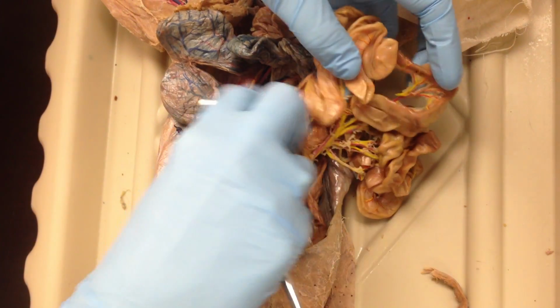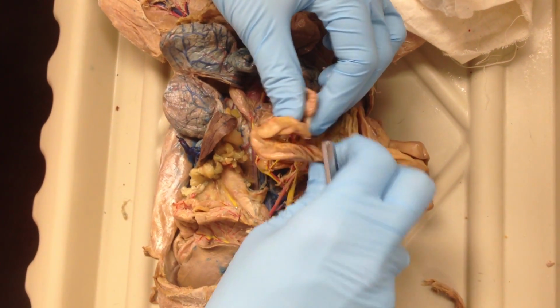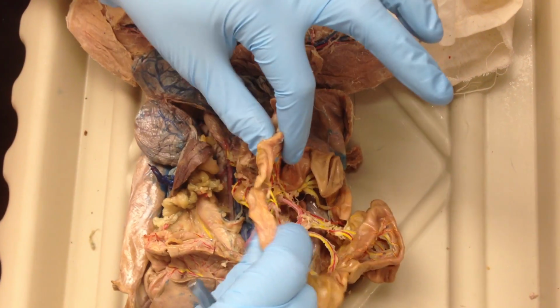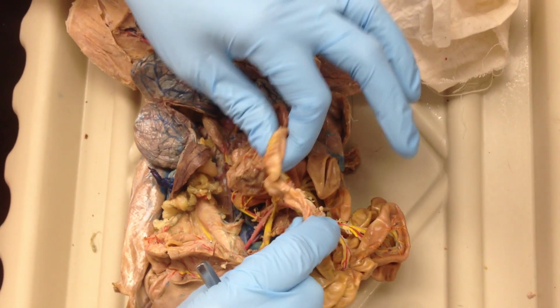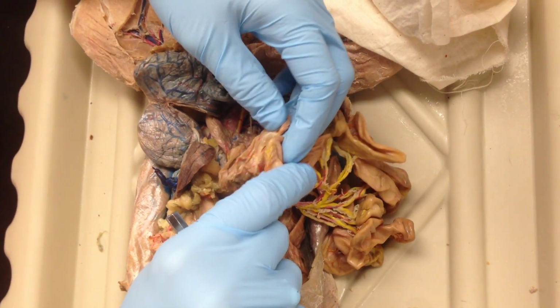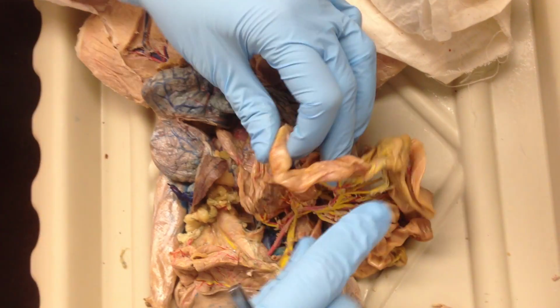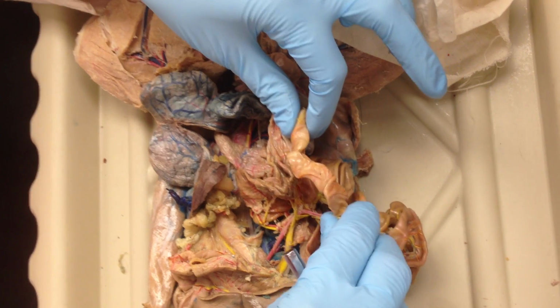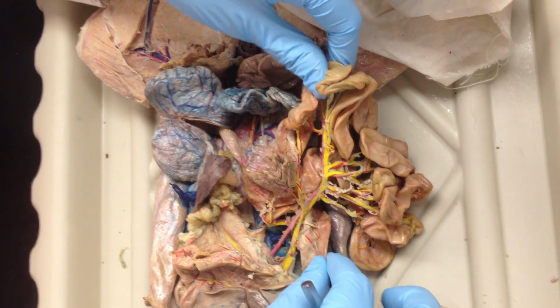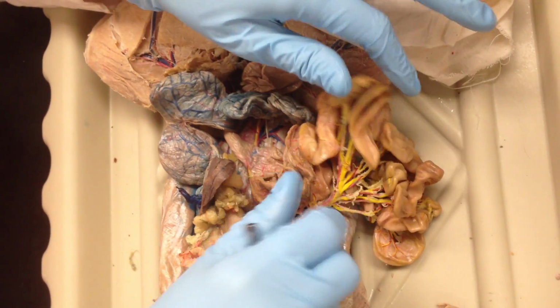And then really the only way we can distinguish between the three parts of the small intestine is to find the junction between the small intestine and the large intestine, and that is definitely the last part, which is called ileum, at the ileocecal or ileocolic junction. And this is the ileum portion of the small intestine, and this is the duodenal portion. That's how we delineate those. So anything that we tag in the middle is pretty much going to be called jejunum.